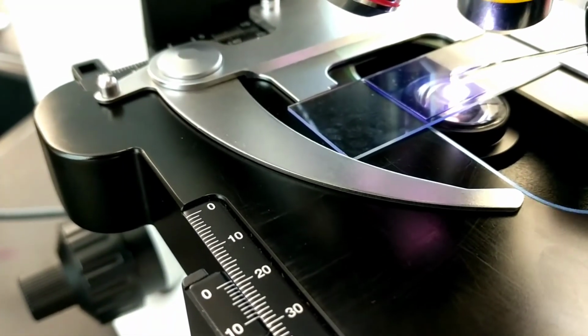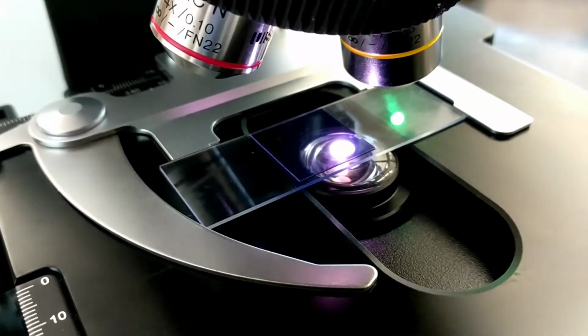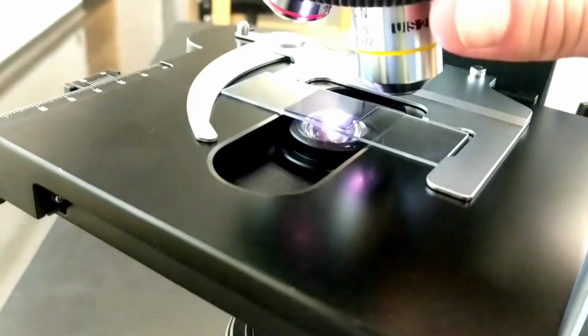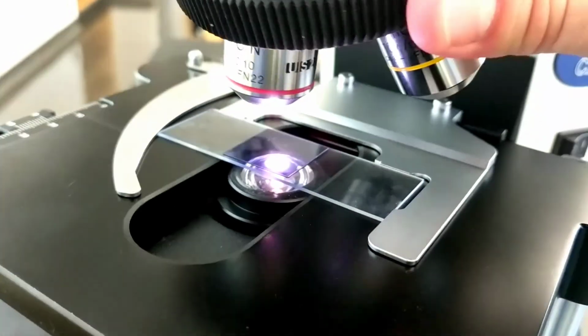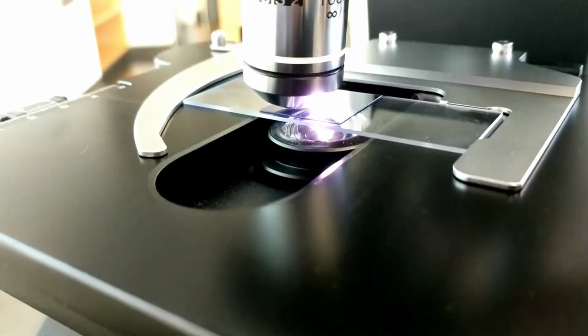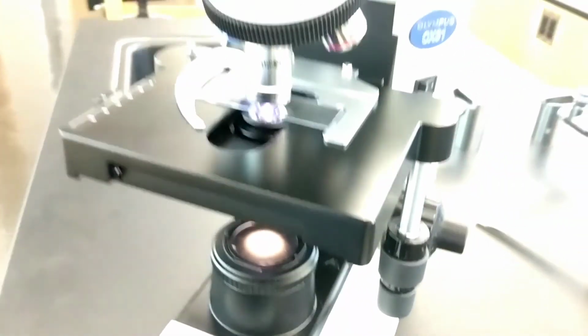So gently, you place the drop of immersion oil on top of the cover slip. It may be a little hard to see here, but I put that oil so that when we rotate the oil immersion lens into place very slowly and carefully, it'll actually physically dip down into the oil and click into place.